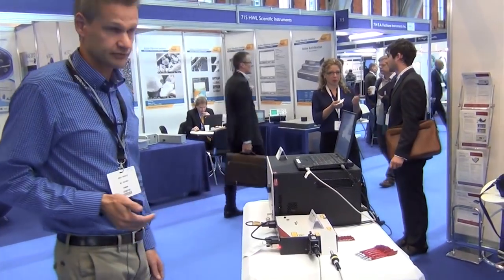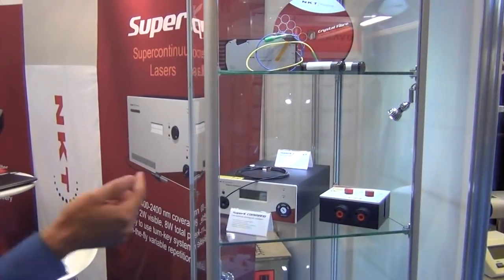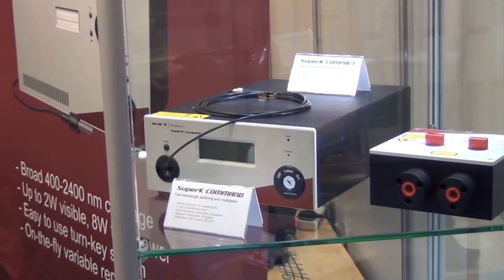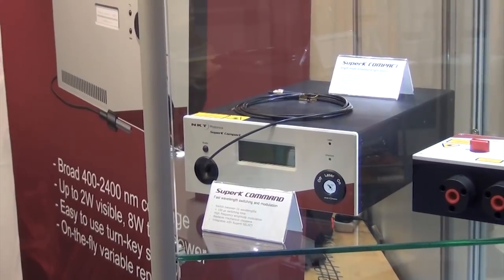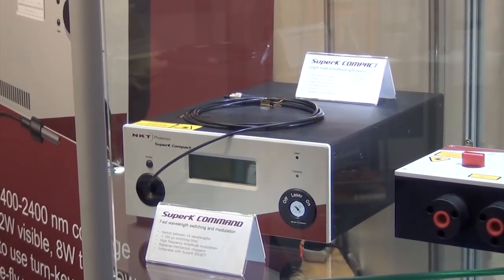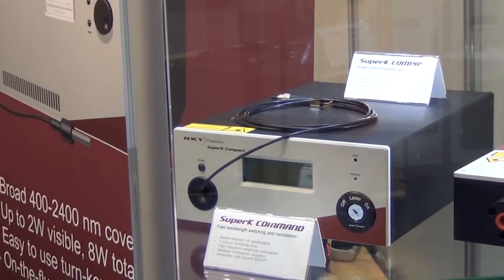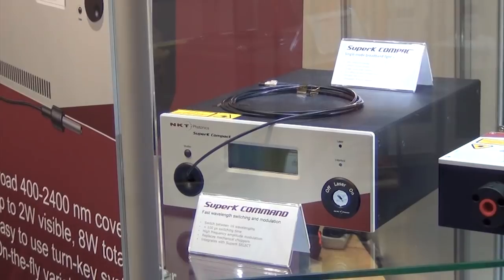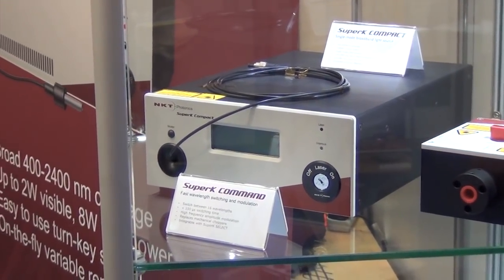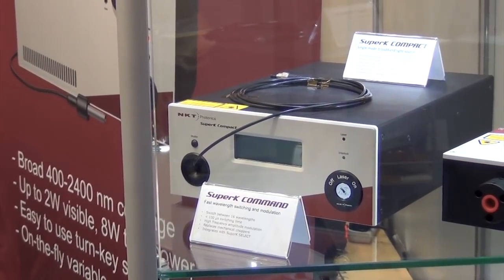We also have other filter devices — for example the Select. This one contains up to 8 individual wavelength channels using so-called AOTF, Acousto-Optical Tunable Filters, typically used for excitation of multi-wavelength systems. The bandwidth there is roughly 3 to 5 nanometers, determined by the crystal technology within this device.